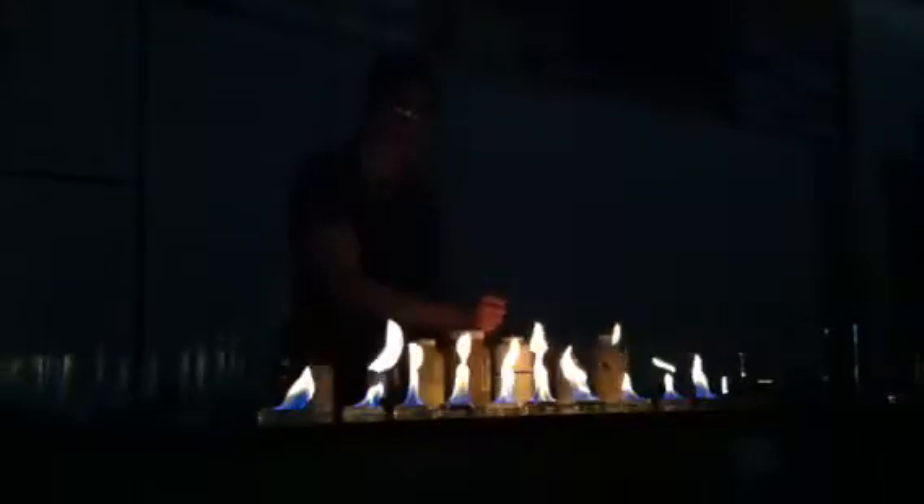There's 900. We talked about the same class last week. This orange-y color right here. Red. Green! This one, by the way, is a mixture of two, which is why you're seeing two different colors. We took the two most popular ones and we mixed them. If you've ever seen birthday candles that burn with colored flame, this is what they're doing.